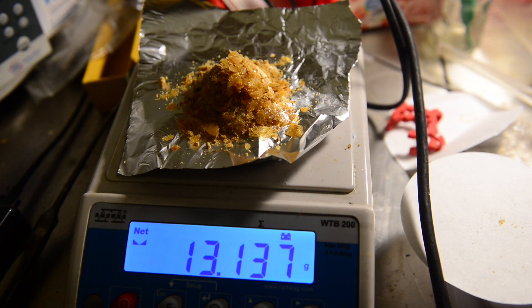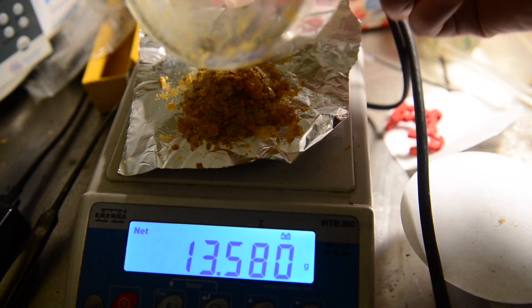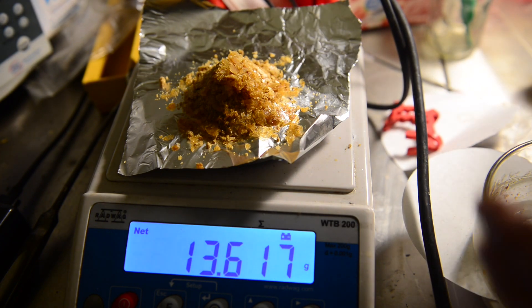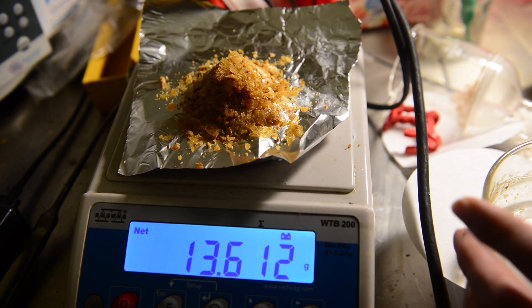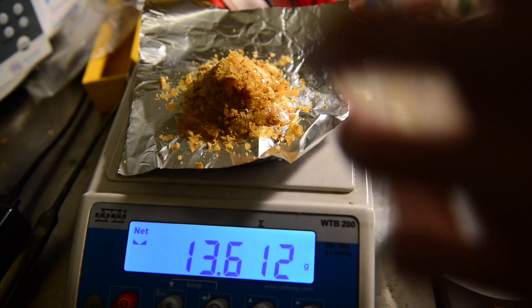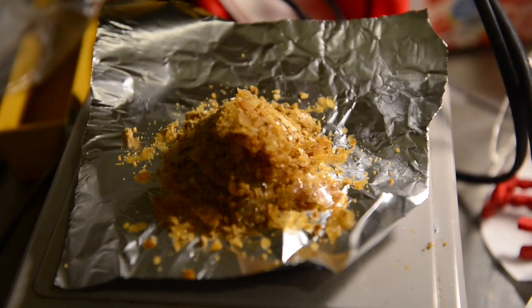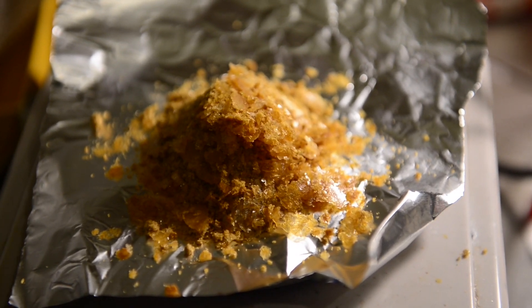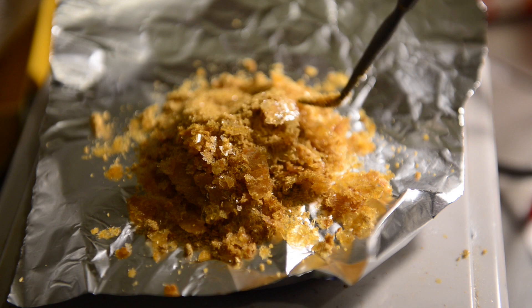It is not bad to take into consideration that I am doing this preparation for the first time and yield in the patent is 89%. Previous failed attempts of mine also make me think that vanillin demethylation is no easy task and this method may be a viable way to achieve good results. I'm quite happy with the results but as far as we've seen after the complex decomposition some of the unreacted aluminum maybe it would be better to do amalgamation as patent recommended. What do you think?